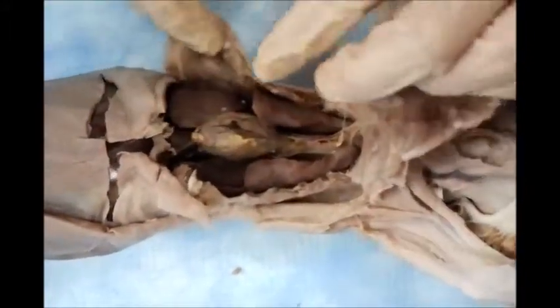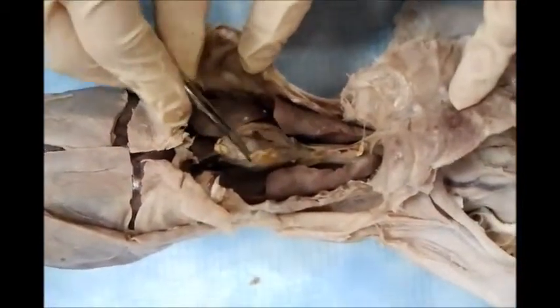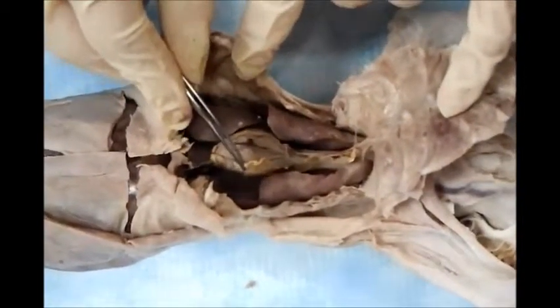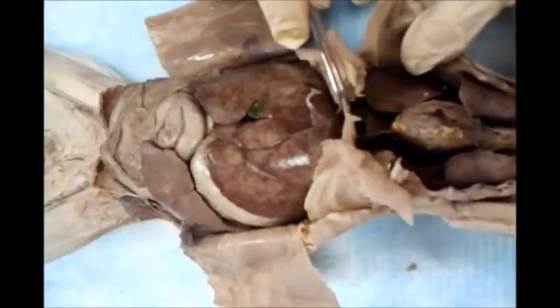Next to that, if that is the heart, we need just only to figure out the covering sheet, which is the pericardium in her hand. And then if we do a longitudinal cut in the heart, nothing could be easily seen. It's a very small, tiny heart, so we cannot follow up. Next, I need to follow up the diaphragm, which is the muscle between the thorax and the abdomen.